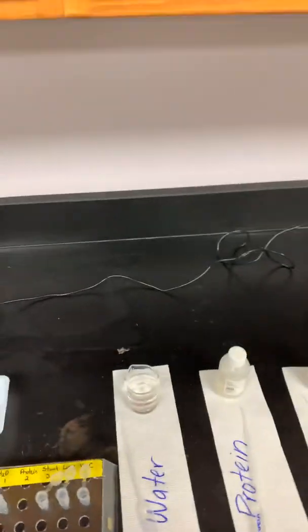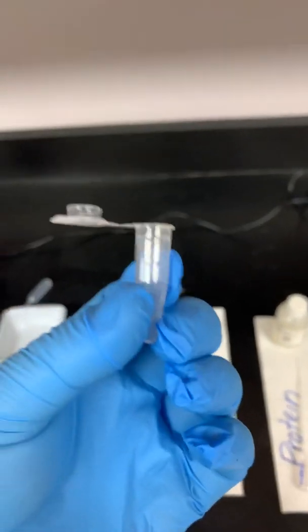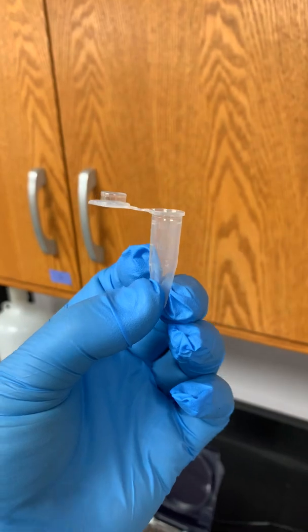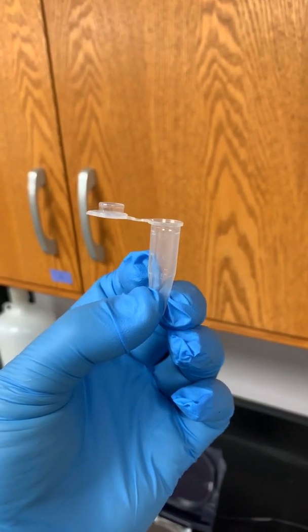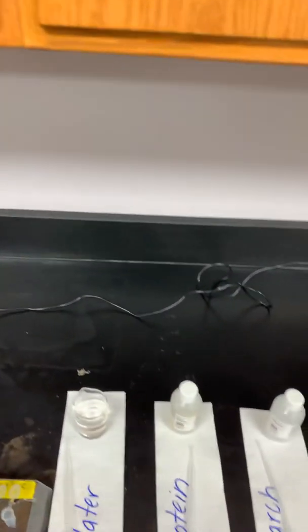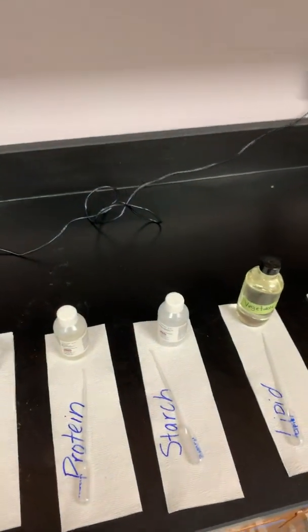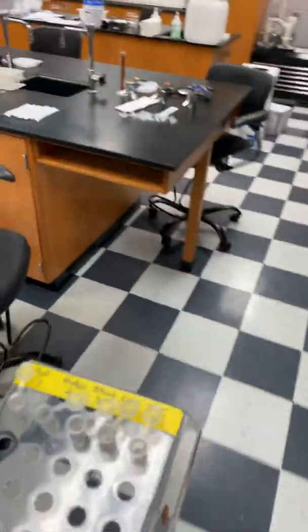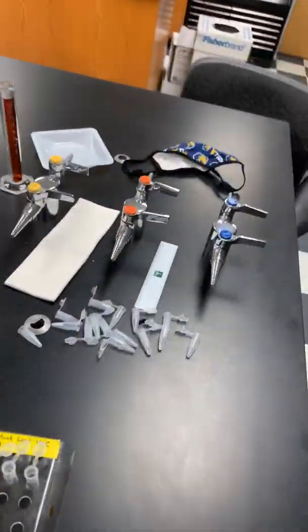Likewise, on your tube, let's go ahead and turn this back this way. On your tube, it actually has some markings also. I don't know if that's going to show up on the video, but definitely take a look at that. When you get to the lab, you'll see it says half mil, 1 mil, and 1.5 mil. And a lot of times we call these 1.5 mil tubes or 1.5 tubes. Again, that's the volume that they hold. But again, these are your microcentrifuge tubes as it refers to them in the handout.